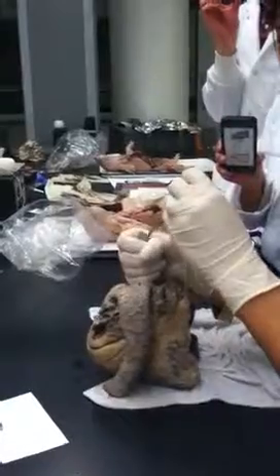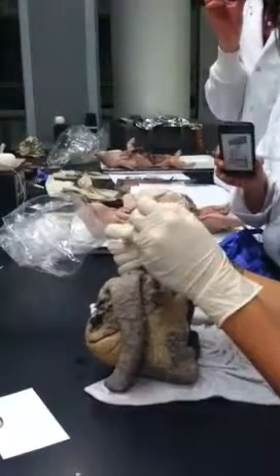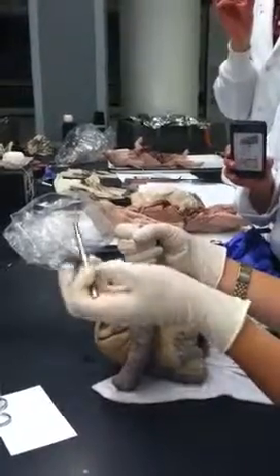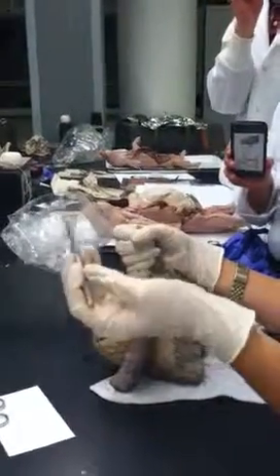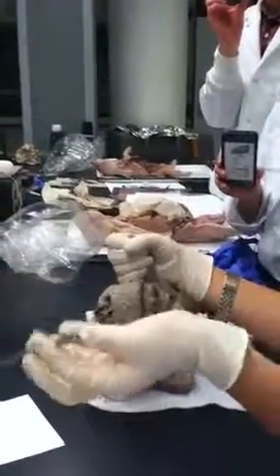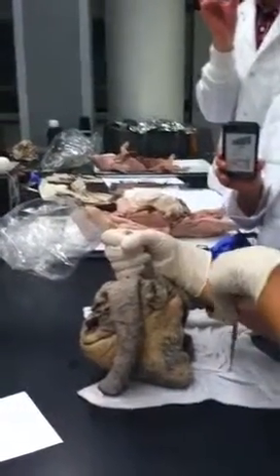So this is brachiocephalic trunk, and it's officially coming off of the arch of the aorta, even though it doesn't really look like it. But if you're doing a trace and we ask you to trace blood to the brain, you would have to say arch of the aorta, brachiocephalic trunk, left common carotid. Does that make sense? Yeah.